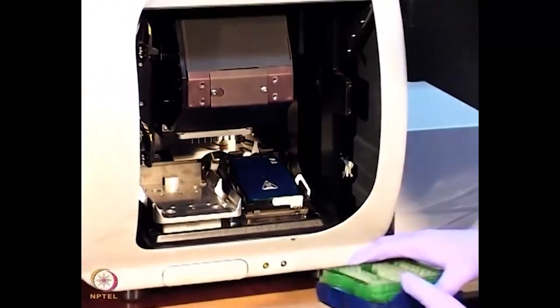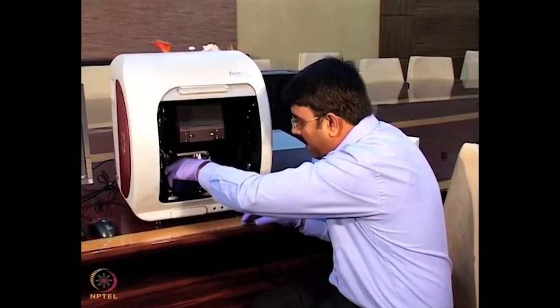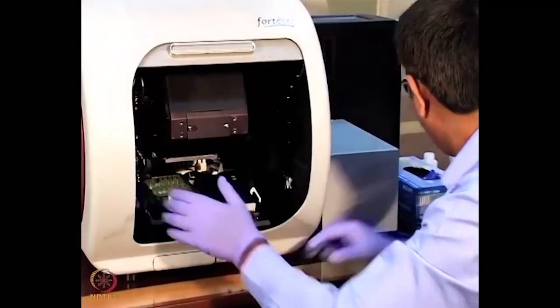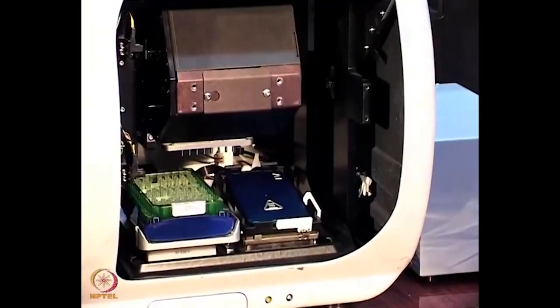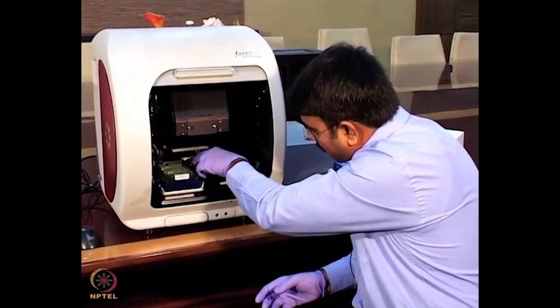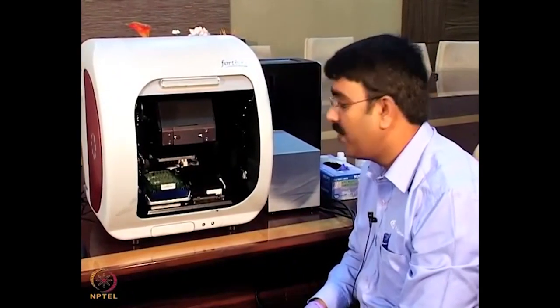This is what we call the sensor holder or sensor manifold. We can put the sensor in this fashion and then place the sample. This is the 96-well plate format — we can analyze 96 samples in one go. This works on the principle of dip-and-read as well as bio layer interferometry.